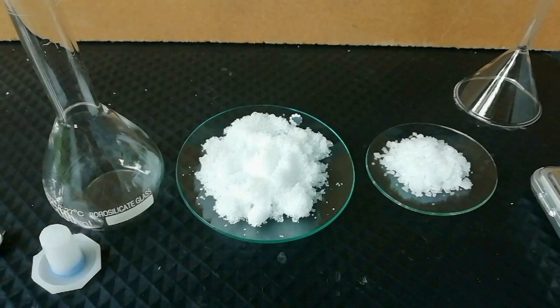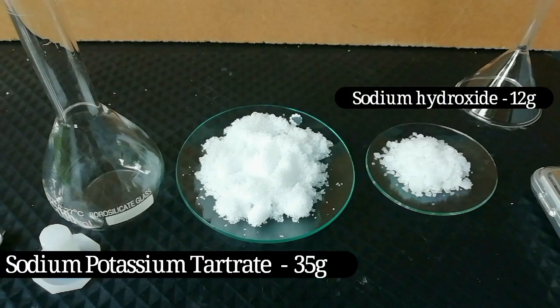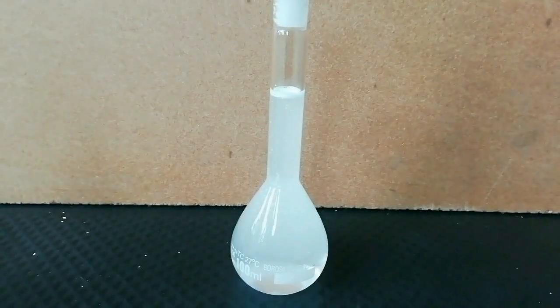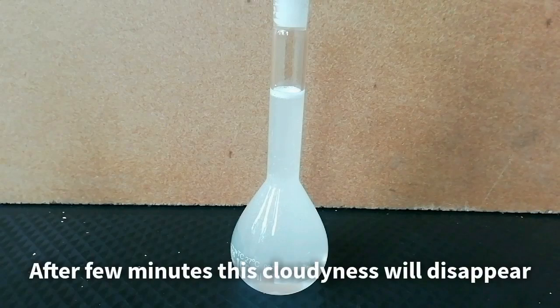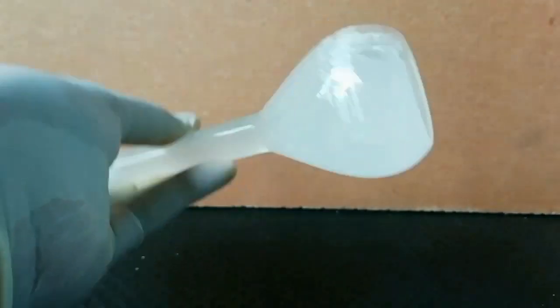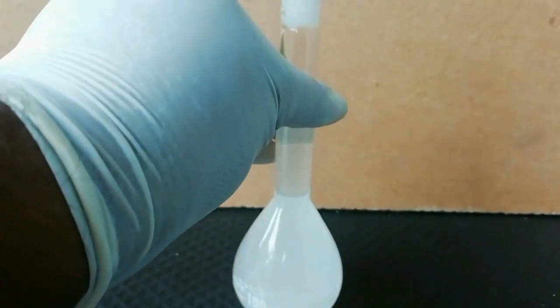In the laboratory, Fehling solution can be seen as two separate solutions, A and B. To prepare solution B, I use 35 grams of sodium potassium tartrate and 12 grams of sodium hydroxide. These two chemicals are dissolved in water and made up to 100 milliliters with water. This solution is called Fehling solution B.